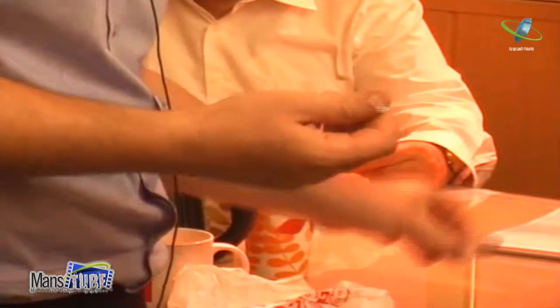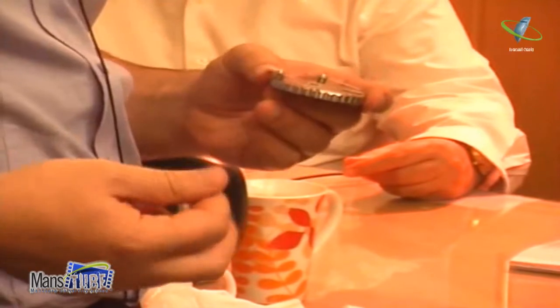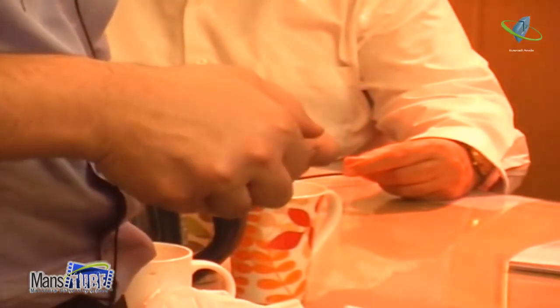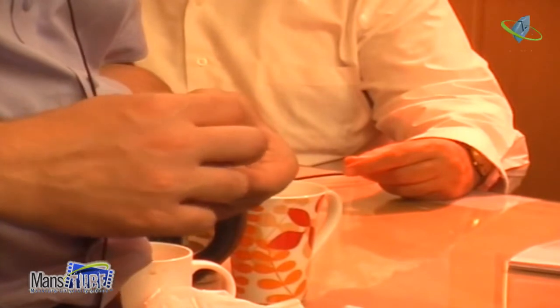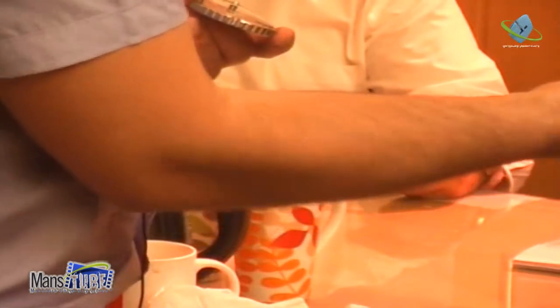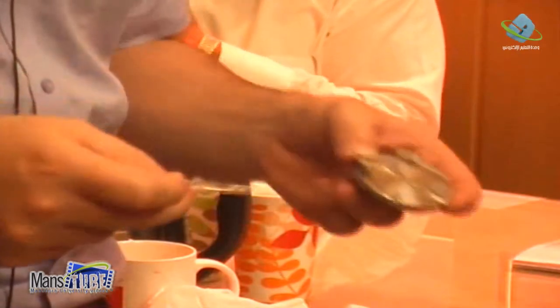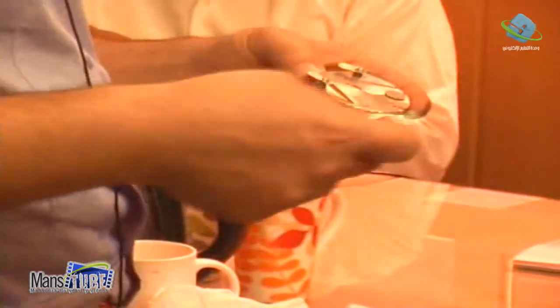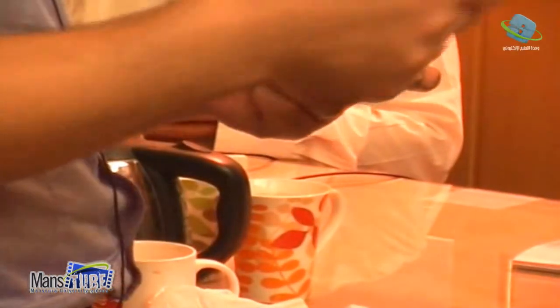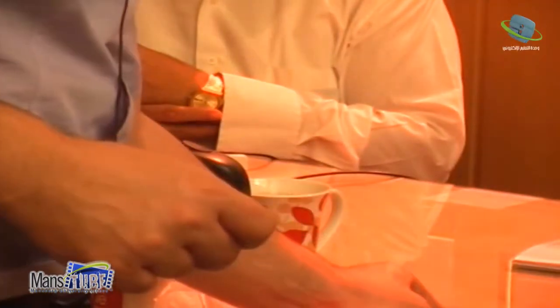Just this one. Let's say you deposit something on the surface. Now you say, I don't want it anymore. I want to prepare a new sample. You just put the scotch like this, and then you pull. You see that I remove a plane. So then I have a clean surface, and I can put new material. If you want to deposit particles, because this is atomically flat, with something like 1 or 2 angstrom, you can really see the difference on the surface. Okay? And it's another example also.